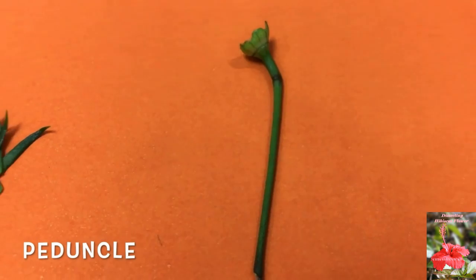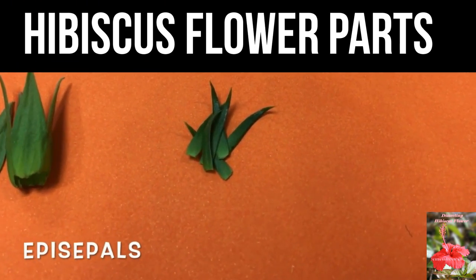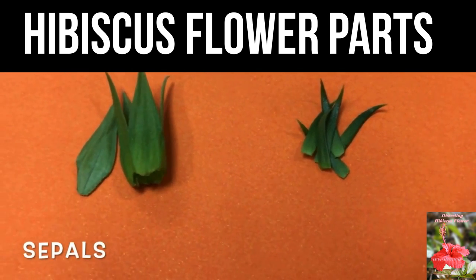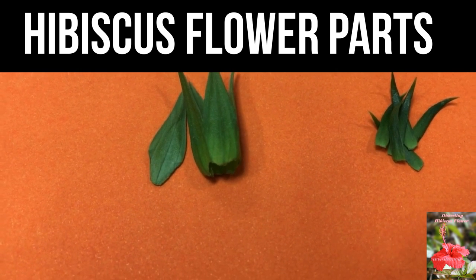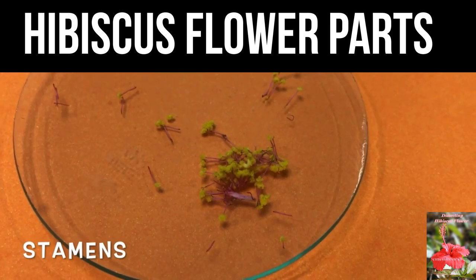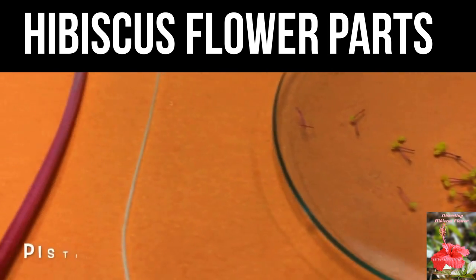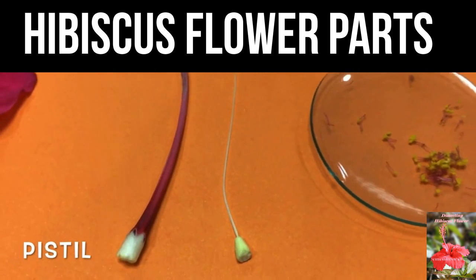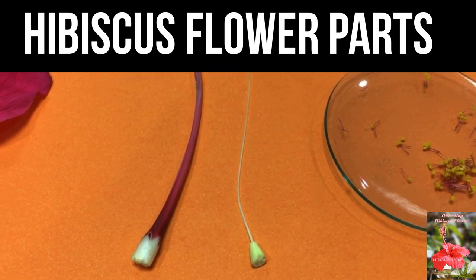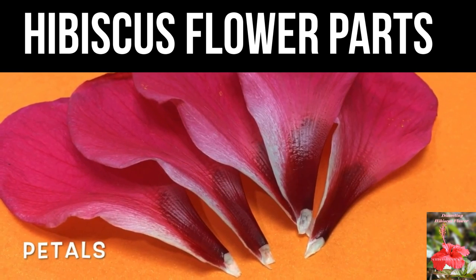Peduncle or stem. Epi-sepals. Sepals. Stamens. Pistil. Petals.